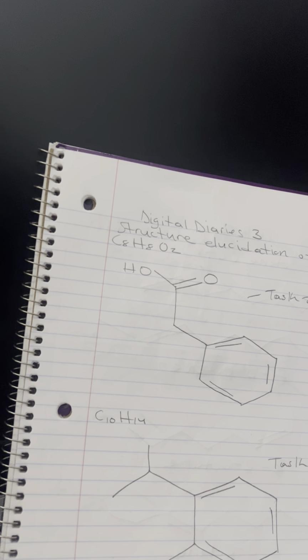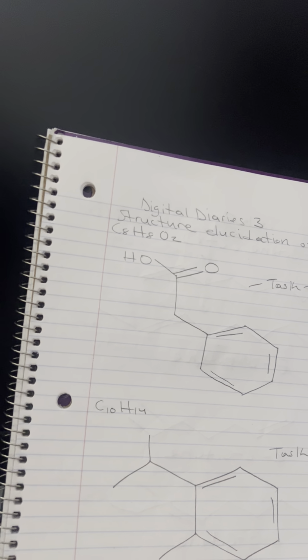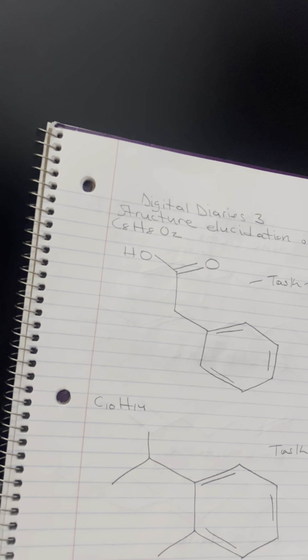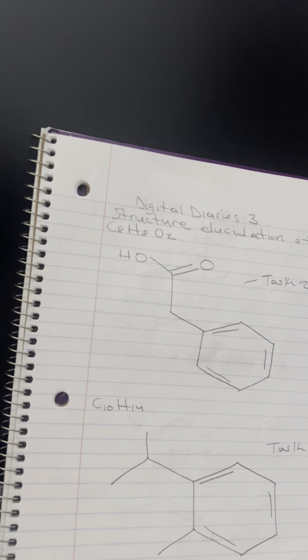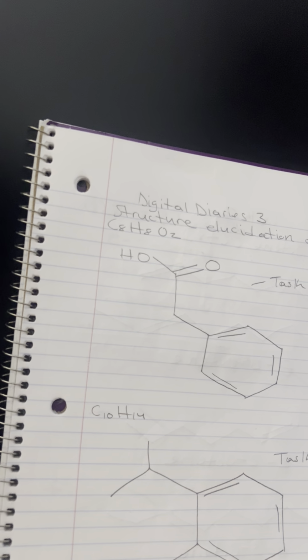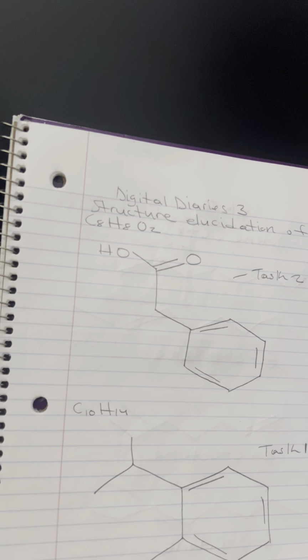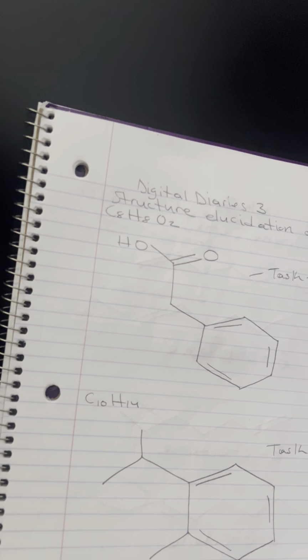To analyze this spectrum further, identify key peaks, especially those with high intensity, as they indicate strong absorbance. Compare those peaks with known absorption ranges for common functional groups. Then examine the molecular formula. The molecular formula provides information about the types and numbers of atoms present in the molecule. This can help determine degrees of unsaturation.